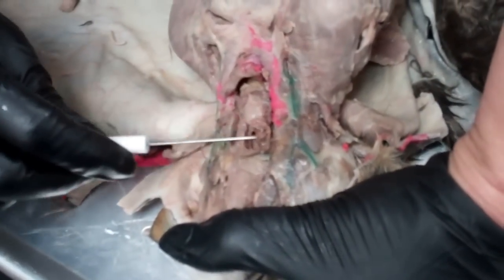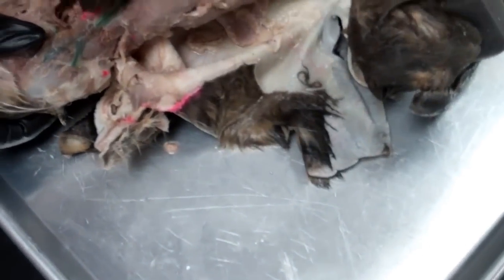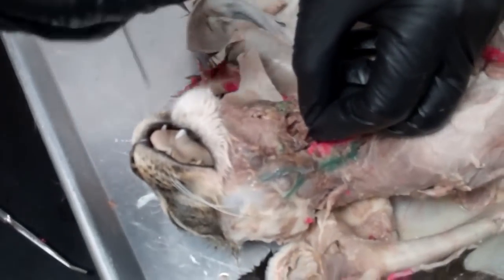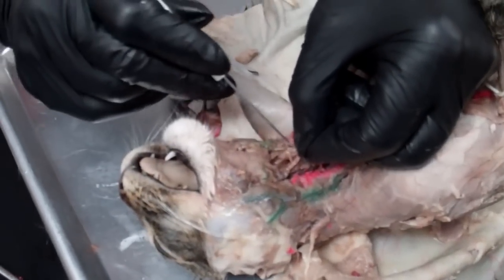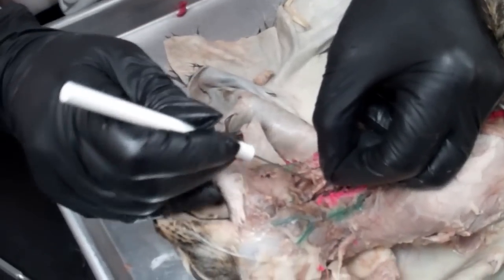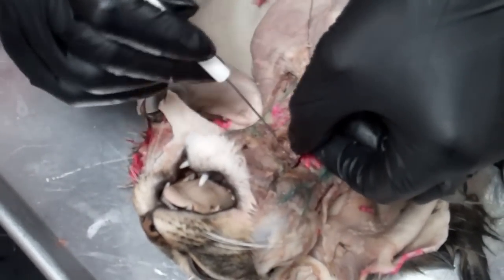You really have to get up there pretty high, and now if I pull this down, there's a little tiny tongue-like structure right there. This structure right here is the epiglottis — kind of flipping it back and forth. Right down underneath here you can see that opening — that's the opening to the trachea, and that's where the vocal cords are.